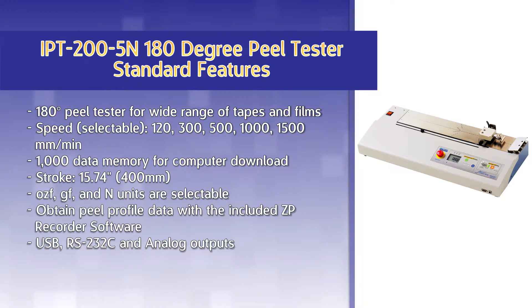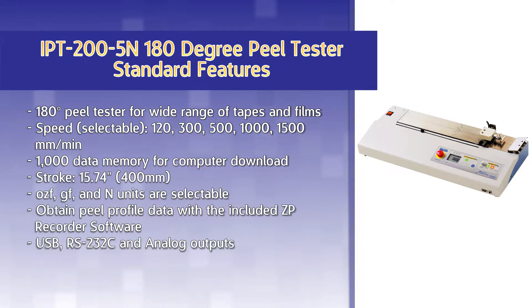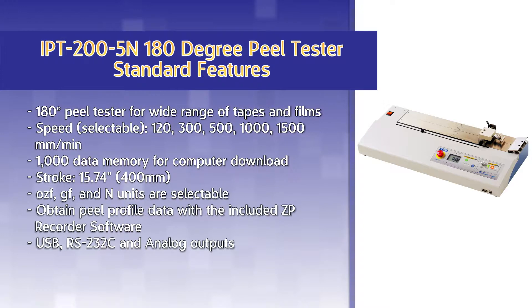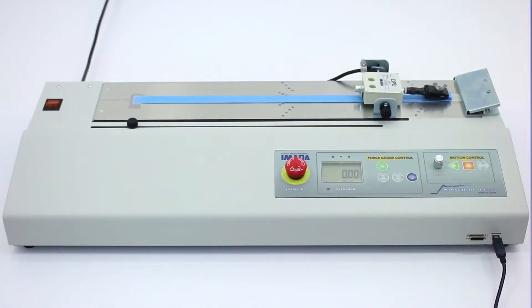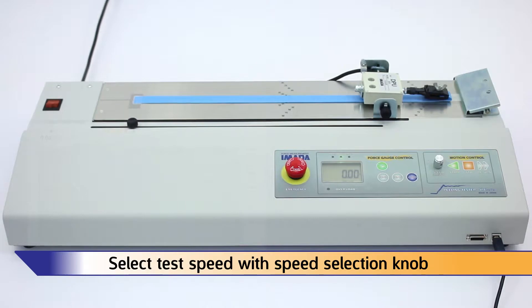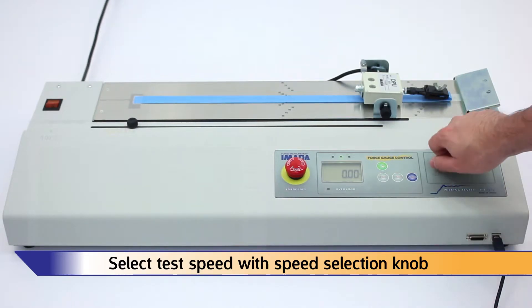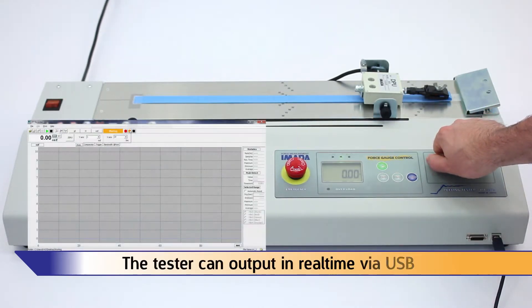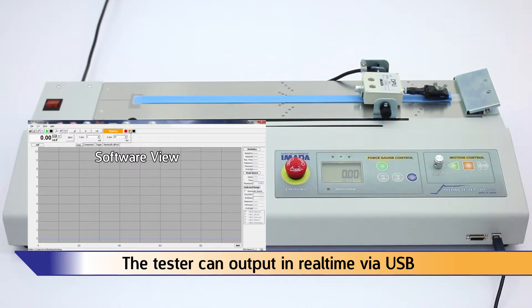The tester has USB, RS-232, and analog outputs. Set the speed for the test using the speed selection knob. The tester can output in real time via USB.